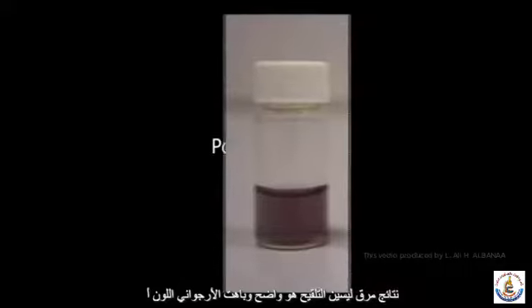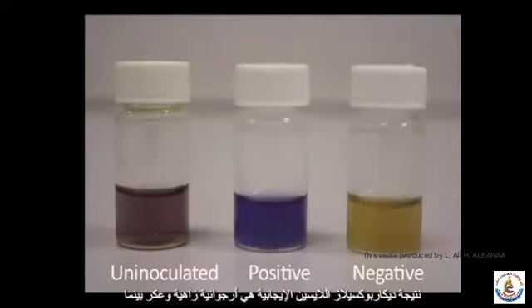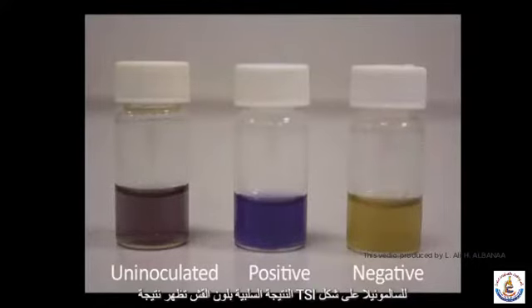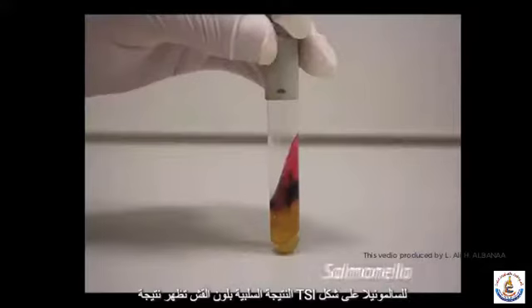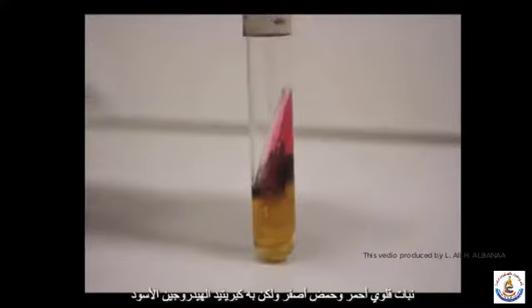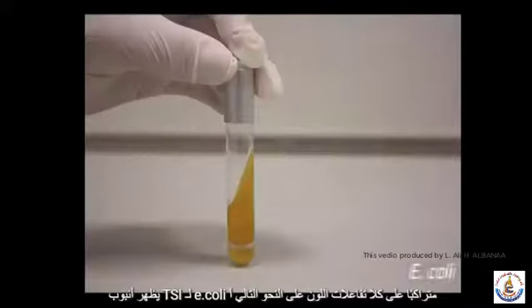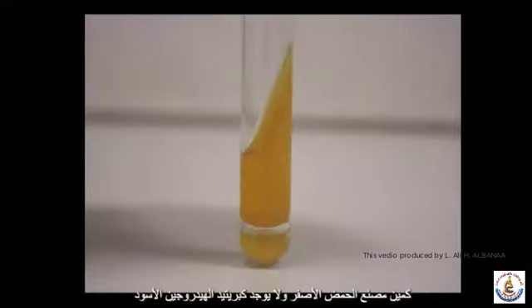Possible results. Uninoculated lysine broth is clear and dull purple in colour. A positive lysine decarboxylase result is bright purple and turbid, while a negative result is straw-coloured. The TSI result for Salmonella appears as a red alkaline slant and a yellow acid butt, with black hydrogen sulfide superimposed on both colour reactions. The TSI tube for E. coli appears as follows: a yellow acid slant and butt, and no black hydrogen sulfide.